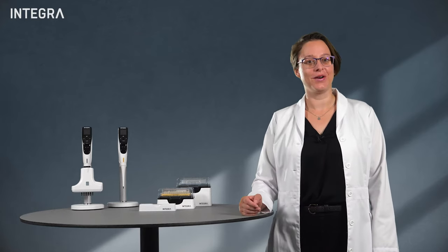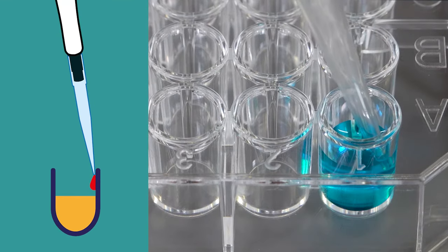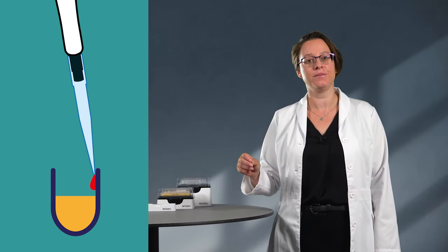A tip touch, or sometimes called touch-off, is a common technique used to remove this drop. To do so, the side of the vessel can simply be touched with the tip to remove the drop. Often, the tip is kept on the side of the vessel during dispensing and then simply slid back up along the wall.